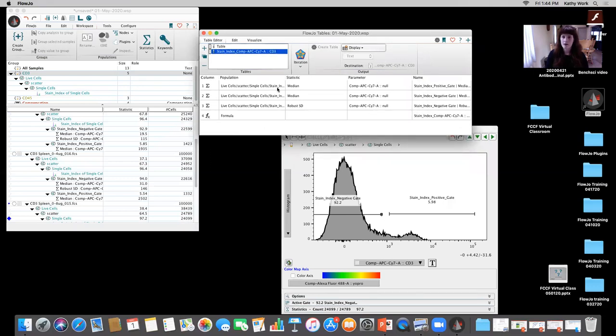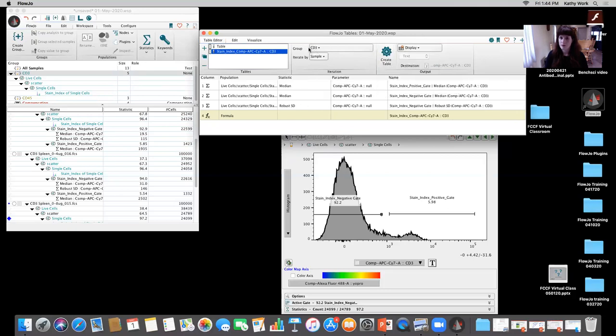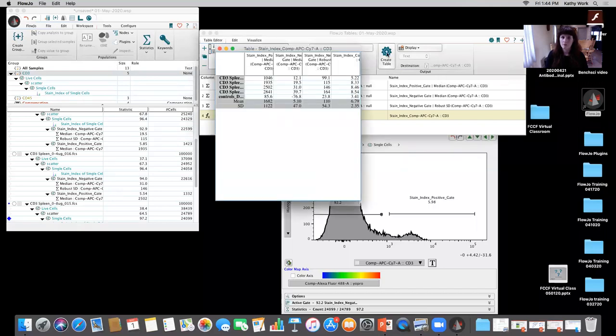Now, it automatically goes ahead and pulls in the stats that are needed: the robust standard deviation, the MFI of the positive, the MFI of the negative, and also the robust standard deviation of the negative. It automatically creates the formula I've discussed how to create in previous sessions. And what we can do if we go to table editor, right, is we can specify that we only want the CD3 group to be calculated. And you can create a table to display, to file, to the layout, to clipboard. There are all these different options to you, but I'm going to go ahead and create it to the table, okay?